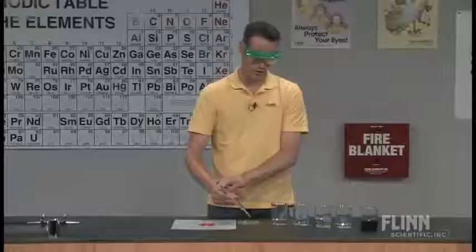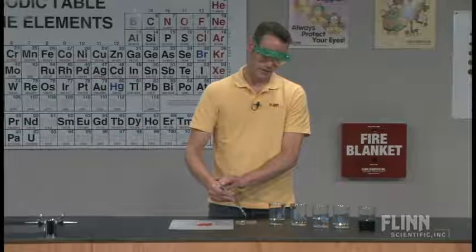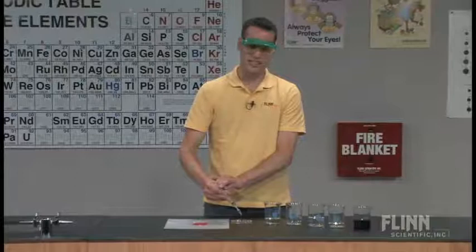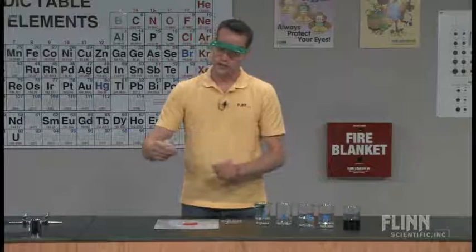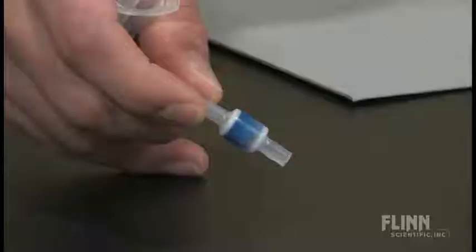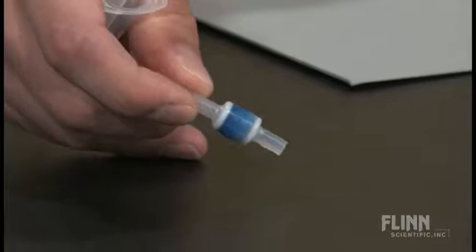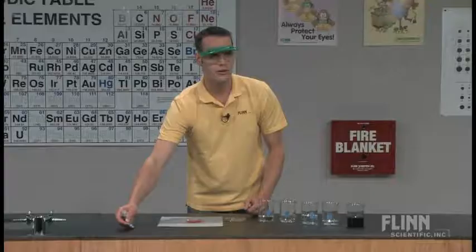One of the nice things about chromatography and the mixture separation is that the students can see very visually the color changes that are happening as they're separating these mixtures. Chromatography, chroma, the root word is color. So this was originally just a separation based on color. If you look at the cartridge now, though, it's almost completely solid blue. There's very little red, if any, left whatsoever inside the cartridge. So we've pushed through all the red and separated that.